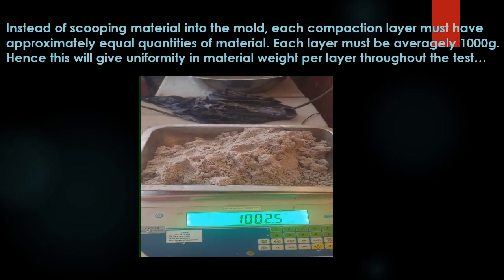Instead of scooping material into the mold, each compaction layer must have approximately equal quantities of material. Each layer must be averagely 1,000 grams, hence this will give uniformity in material weight per layer throughout the test.